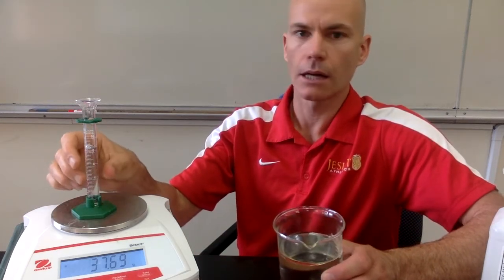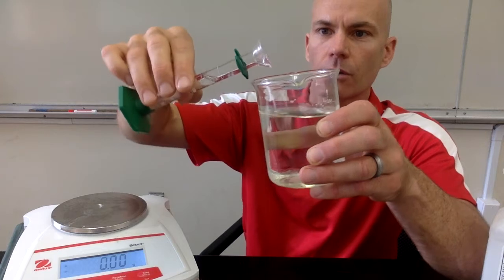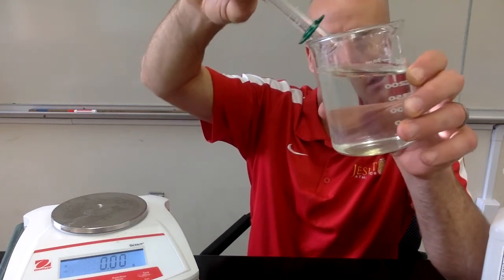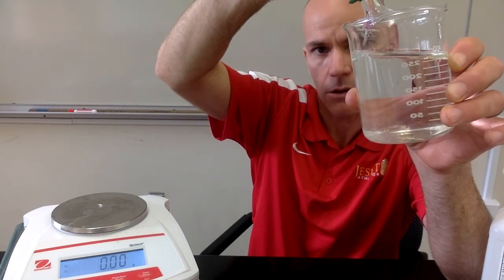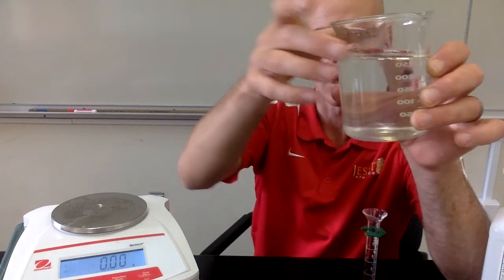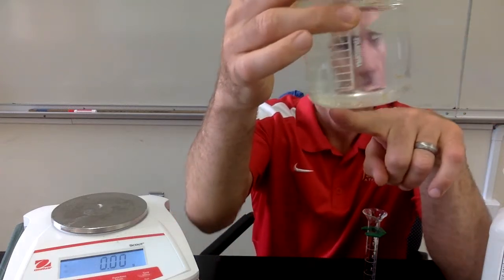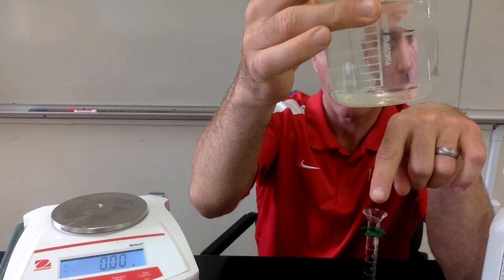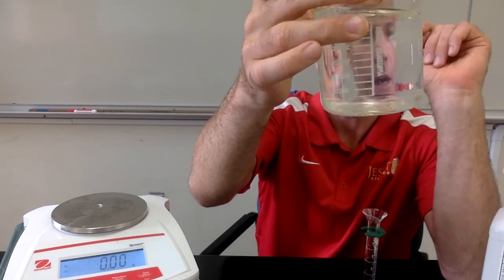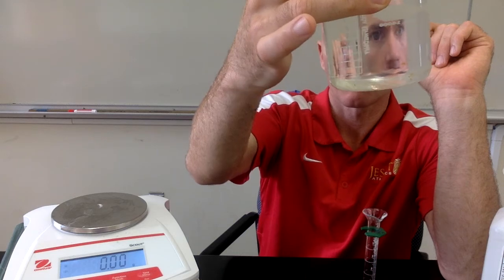Again, this one might be a little bit difficult for us to see, but we're going to try to pour this in with water. Even though they're the same color, we'll try to see if it floats or sinks. Yeah, I think you can see that it is sinking in the water. Some of the bubbles are coming up, but the main part of the detergent did sink down to the bottom of our water there. It will mix in eventually, but it does seem to sink in water.